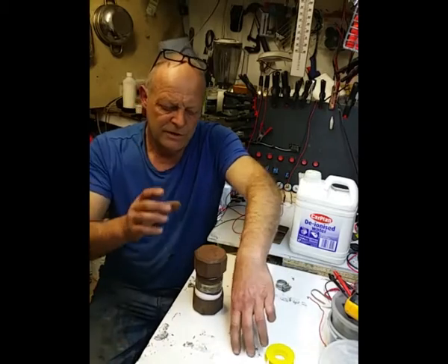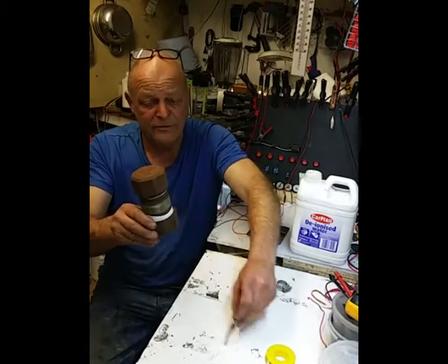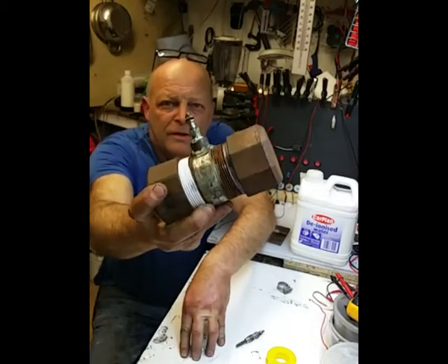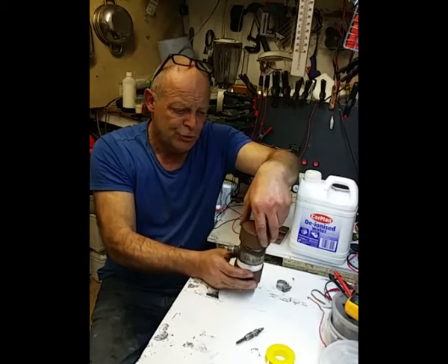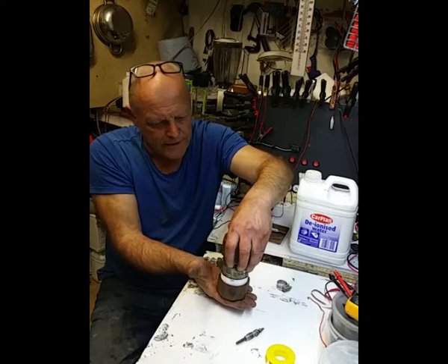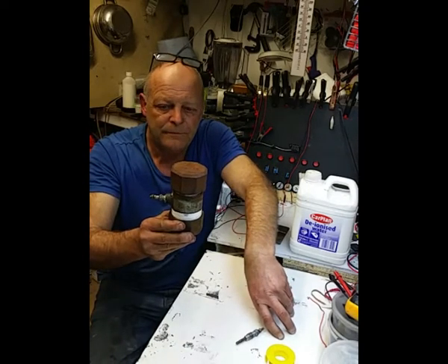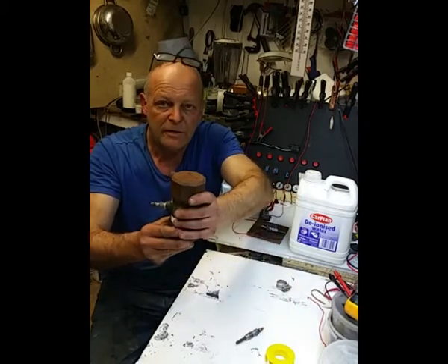So what I said I was going to do was get my mate to weld a boss on this so I could screw that into this chamber, and that's what I've done. There it is. Nice and neat, tidy. And try and use this on the bench. Obviously you've got to sit it on something that's heat resistant, but I wanted to try this on the bench. I haven't tried it yet, but I'm going to try it, and it will be on this video. I won't be carbonising or anything, but I'll be heating the thing up to see what the temperature gets to.